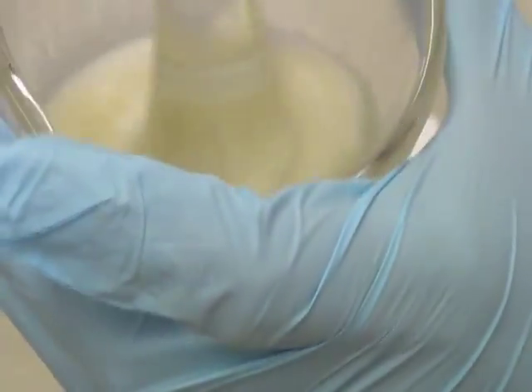You have a creamy white emulsion like this. So that's it. Done.